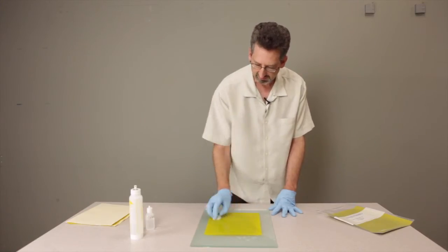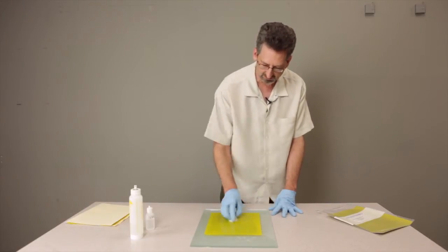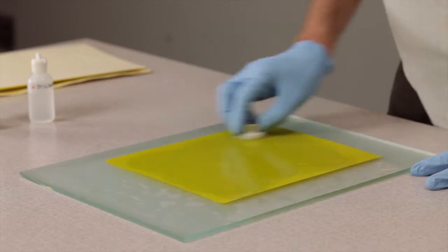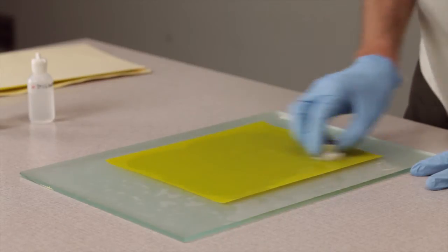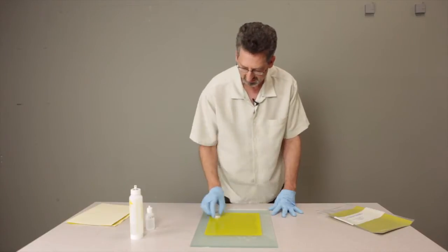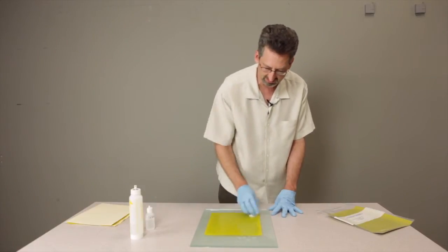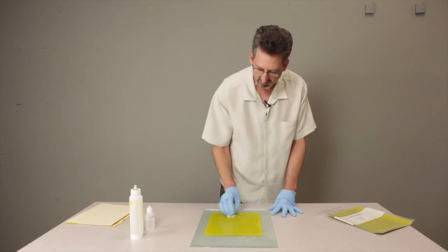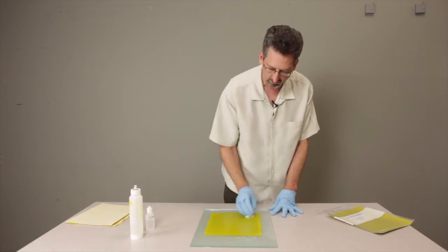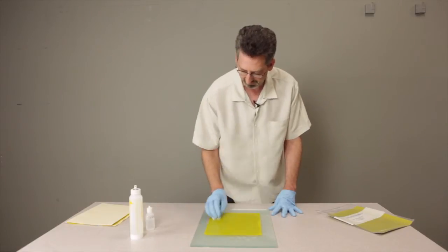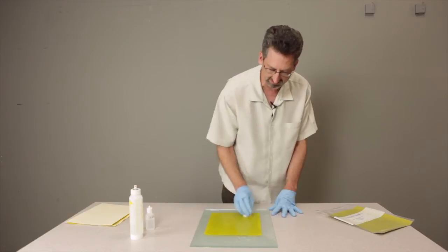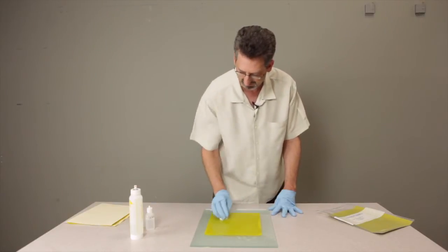Some polishing with a figure eight pattern. So we use most of the surface of the aluminum oxide sheet. We're going up into the corners and the middle is going to be used very regularly. So we're making the most of the film. As the saying goes, work out on the edges and the middle takes care of itself.